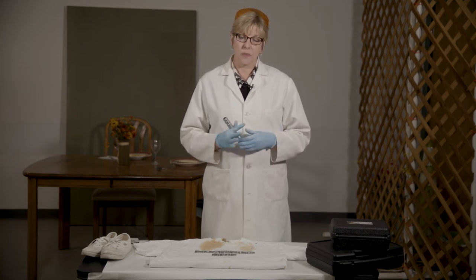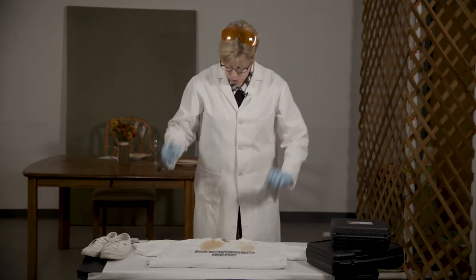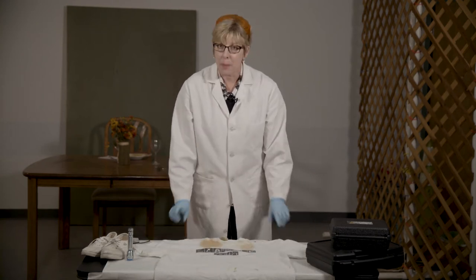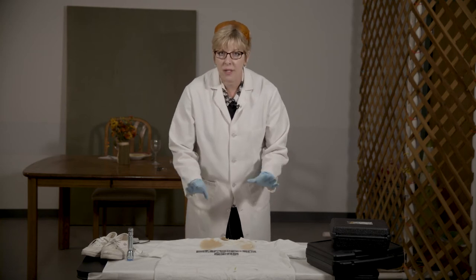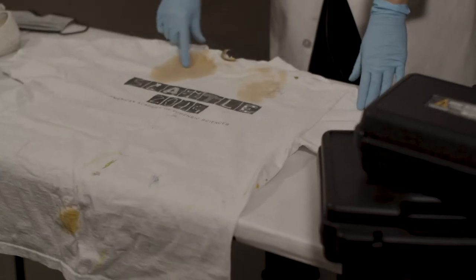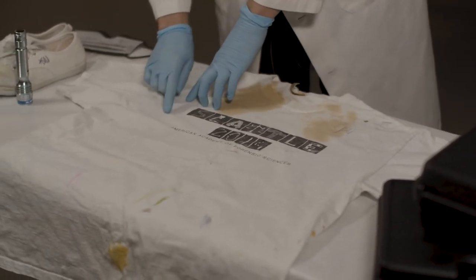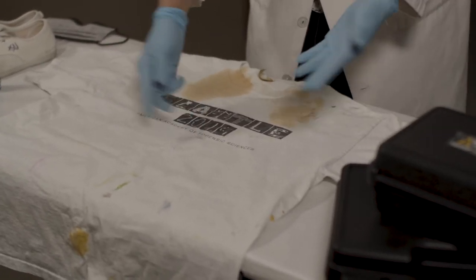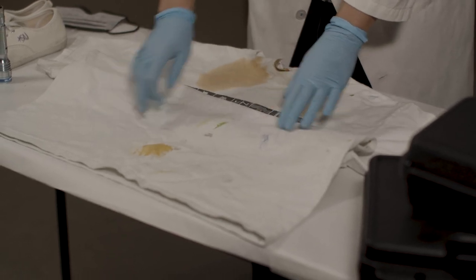What we're going to focus on is the use of a handheld alternate light source that produces blue light — a very affordable tool. We're going to first visually look at this t-shirt that I purposely made messy. As you can see, there's a lot of staining: this orangey staining here, some ink, maybe some green ink, some pink marker, something red-brown — maybe it's blood, maybe it's chocolate. Further down the shirt, we have more of this orangey stuff and some ink.